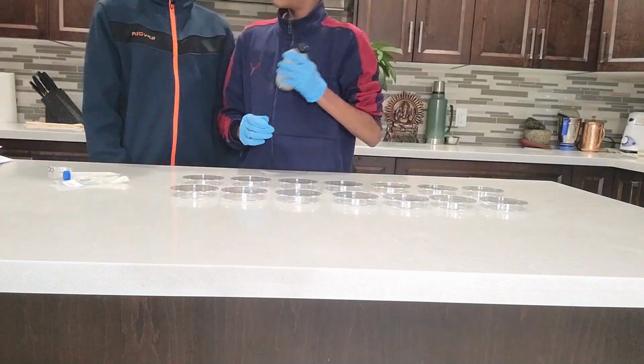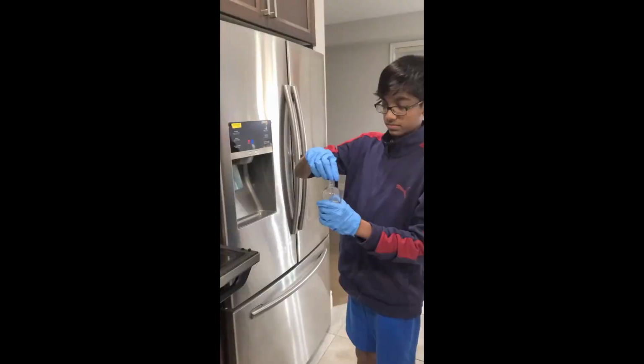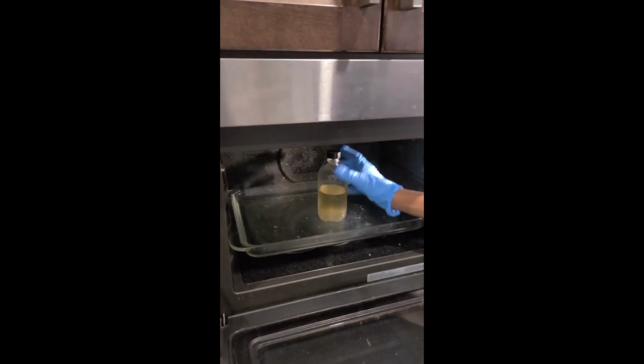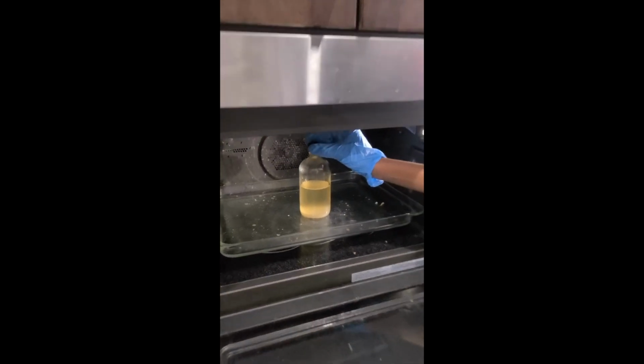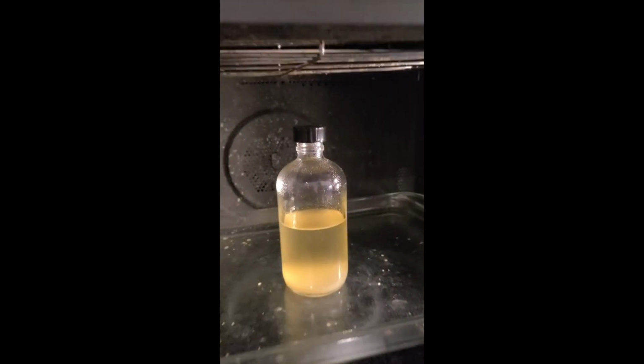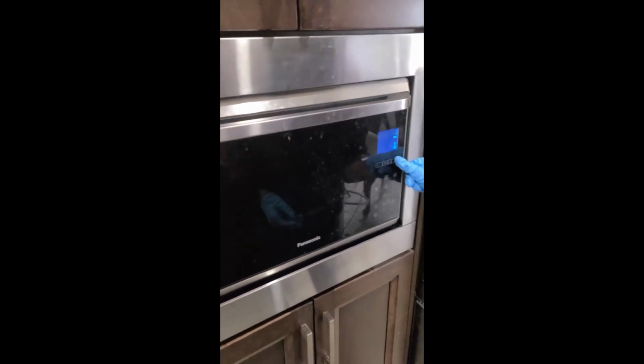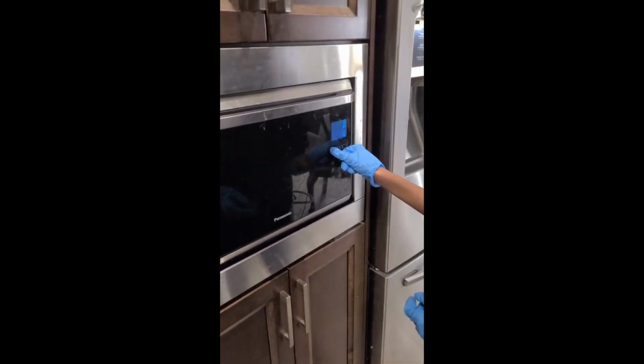First, add 150 milliliters of water into a glass bottle with LB agar powder, which came with the kit provided. Shake the bottle vigorously and heat the bottle in the microwave for less than 30 seconds a number of times until the LB agar powder is completely dissolved. The liquid should be a pale clear liquid after dissolving. Be careful that the solution does not boil and that the lid is placed on top and not tightly closed.